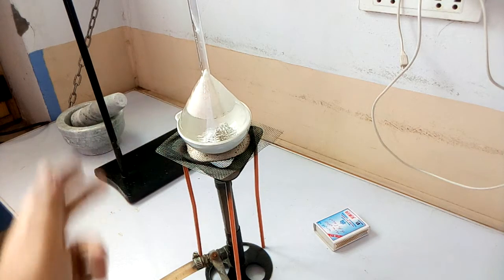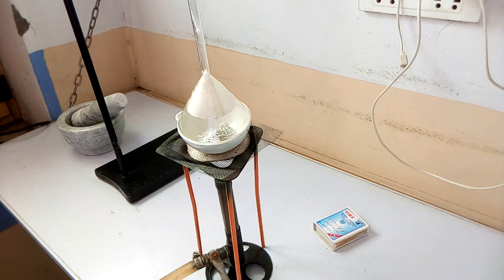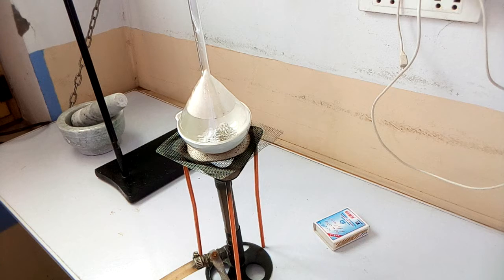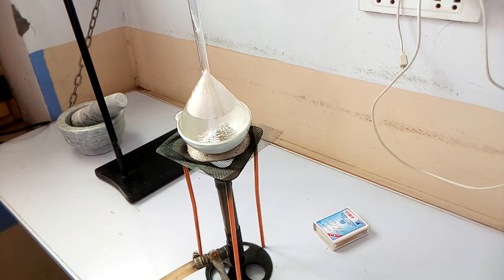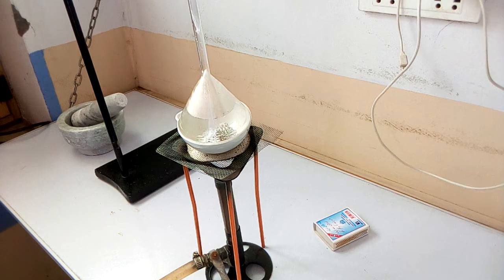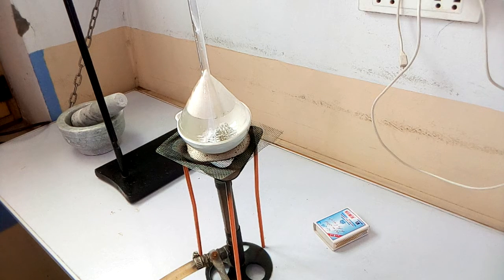We have placed the china dish on the sand bath. We have closed the open end of the funnel with the help of cotton. Now we will heat the sand bath gently with a Bunsen flame. We will stop heating after 5–10 minutes and let the china dish cool down to room temperature.